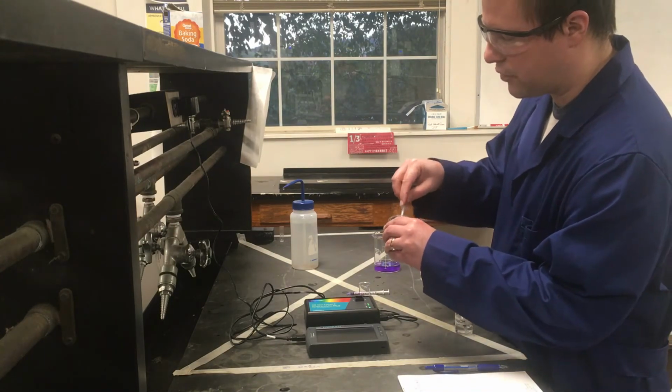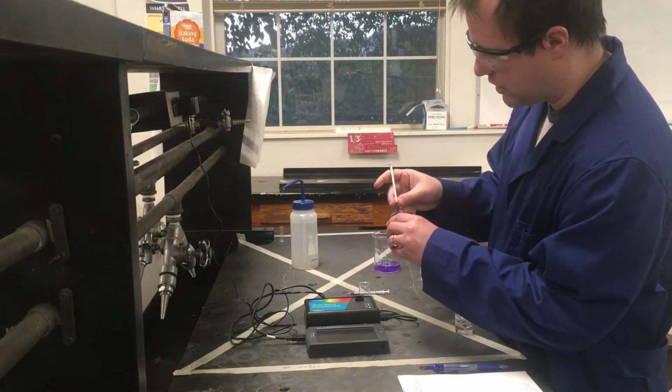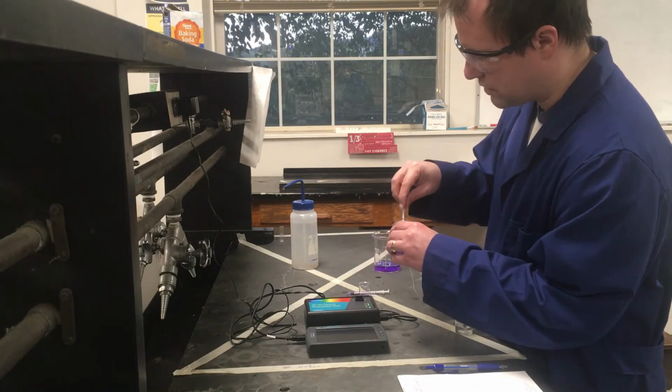And what I'm going to do here is for my reaction, I'm going to measure out all of my crystal violet first. I think it wants us to use about 5 milliliters of our solution, which I should have just enough for that reaction. So measure this out pretty quickly.